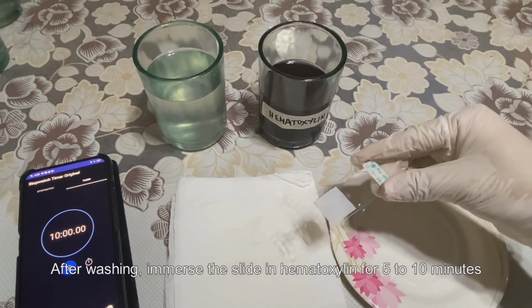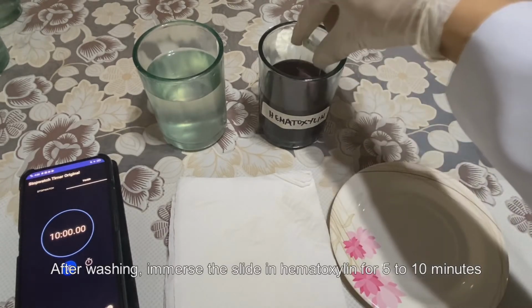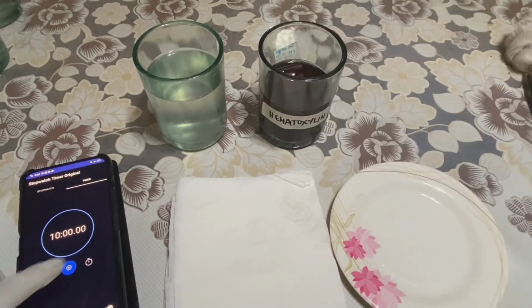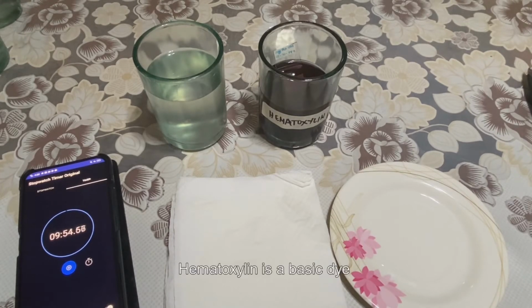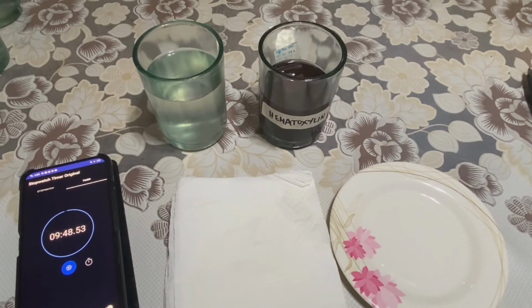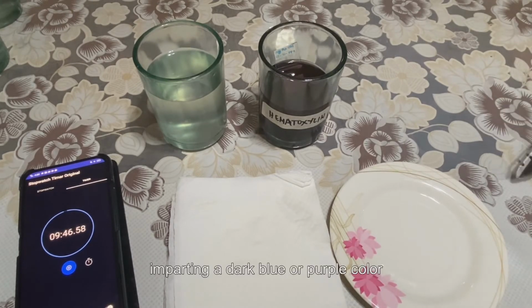After washing, immerse the slide in hematoxylin for 5 to 10 minutes. Hematoxylin is a basic dye which stains acidic components of the cell, such as nucleus, imparting a dark blue or purple color.